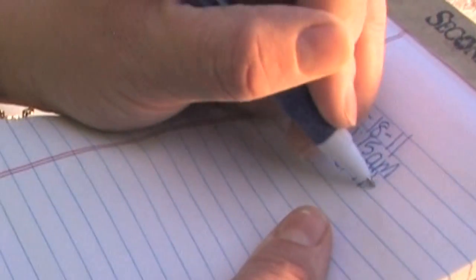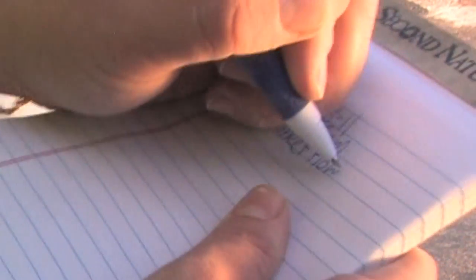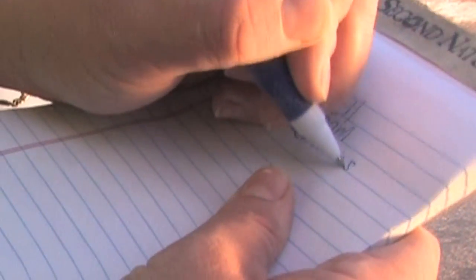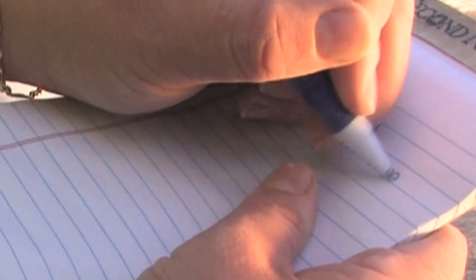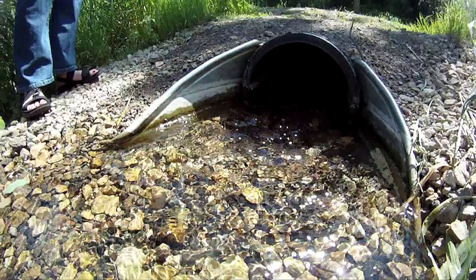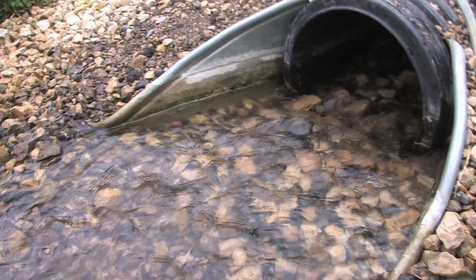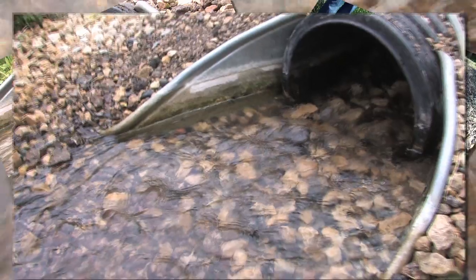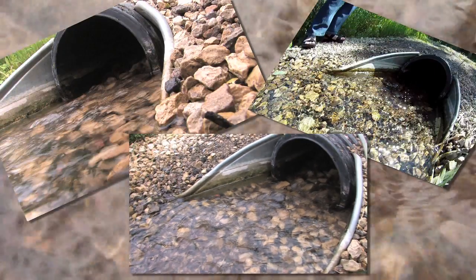After you've taken your sample, make sure to take thorough notes on how the sampling event went and facility conditions. You might want to consider taking a photo of sampling conditions after you take your sample, as this might help remind you of site conditions when filling out the monitoring report.